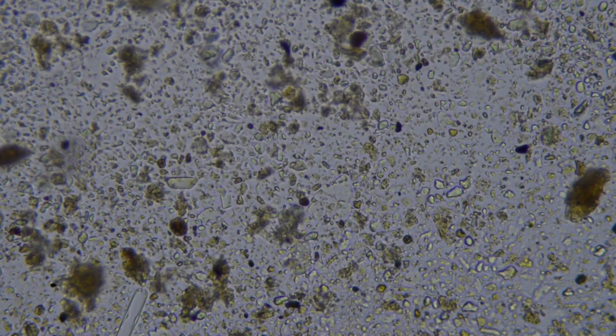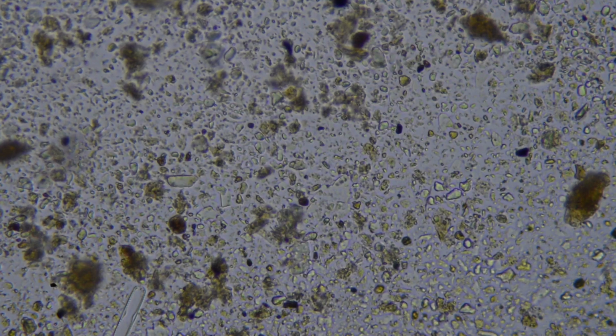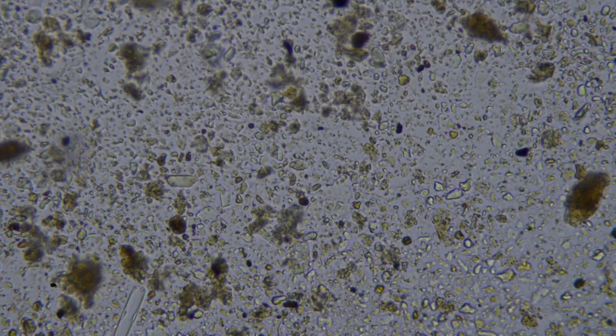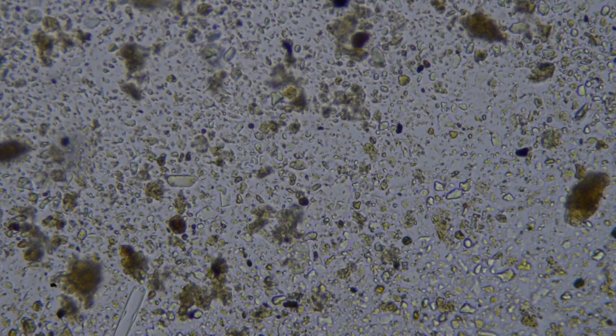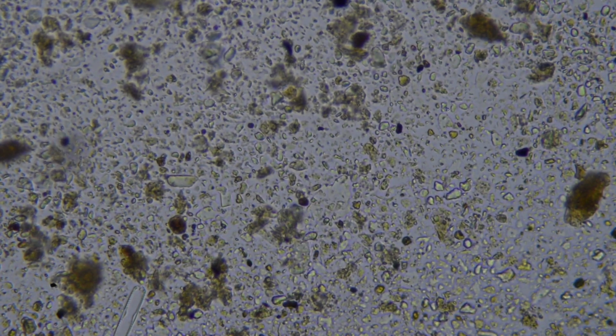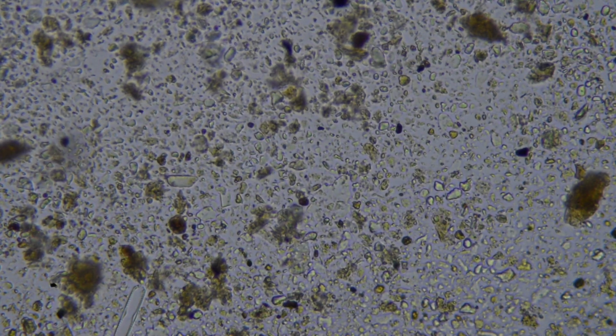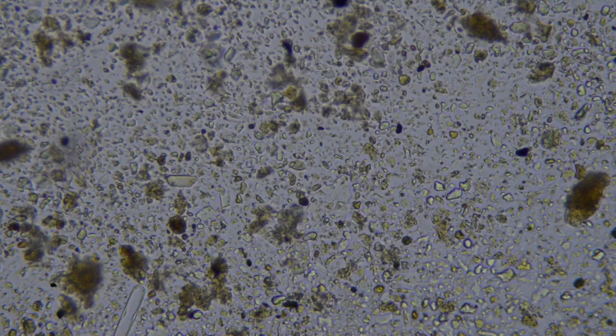We do indeed. Just on my first little scan here, it does look like there's generally quite low diversity. We want to see different types of cocci, so those are the little full stops that you can see, just round little balls, as I zoom in and out.